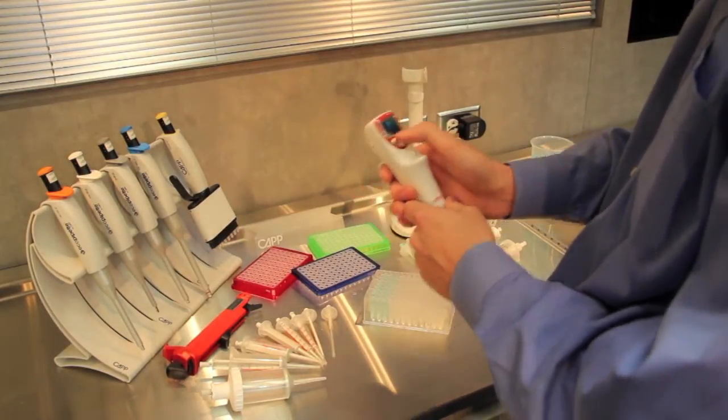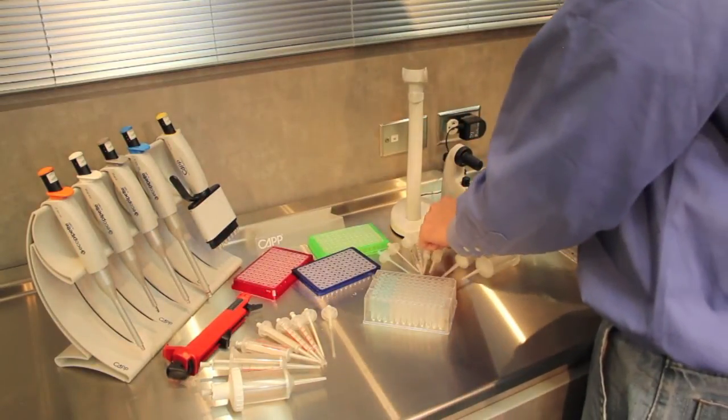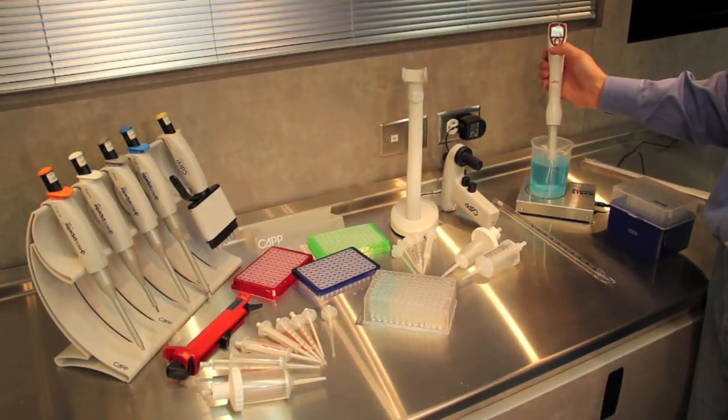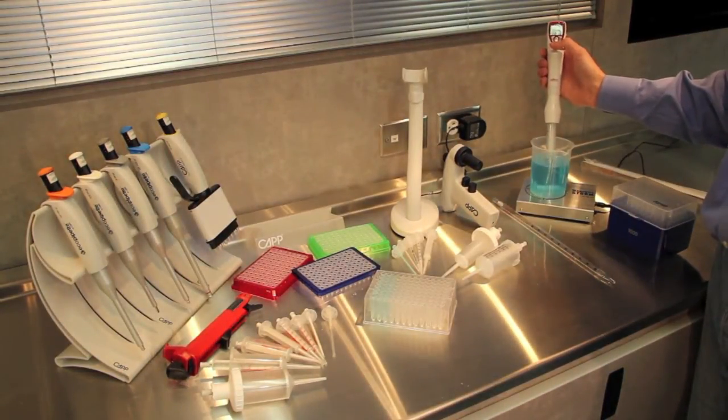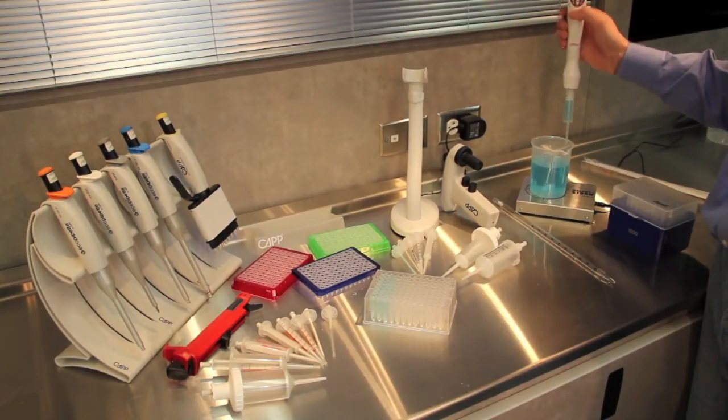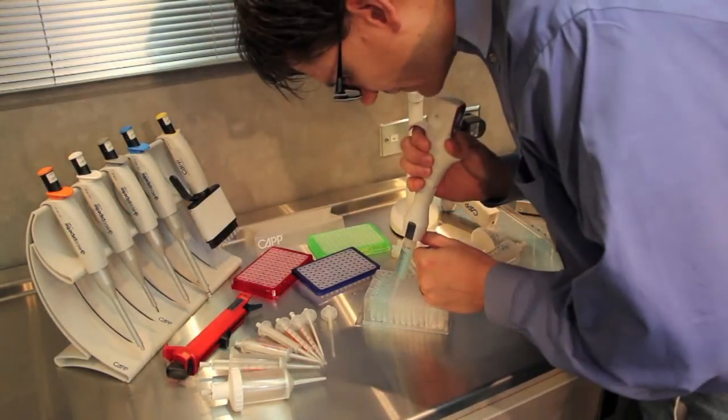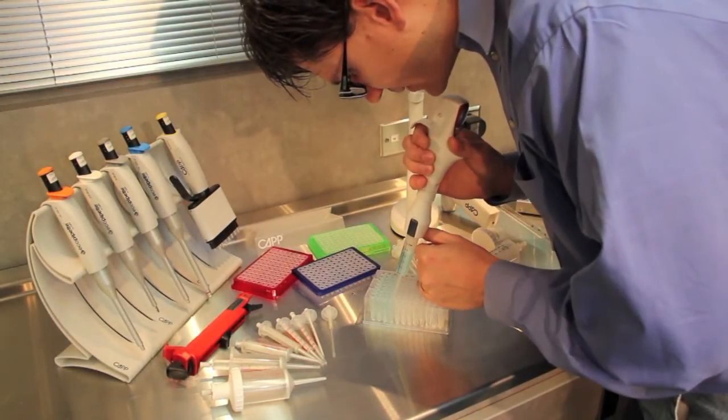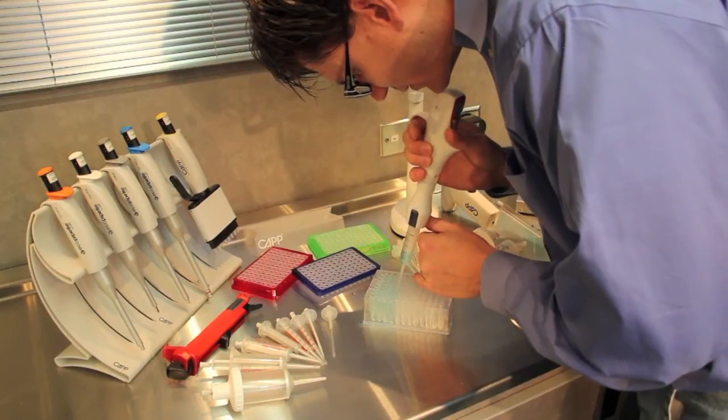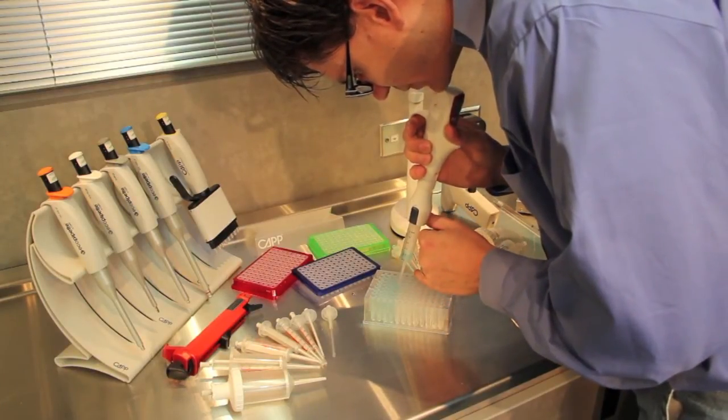Load up the syringe and aspirate up the media, do the blowout. Now every time I push the button it is going to dispense exactly 1ml into the plate.